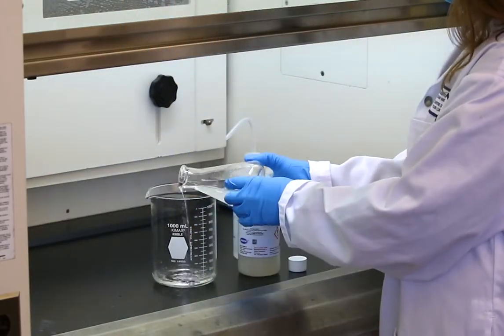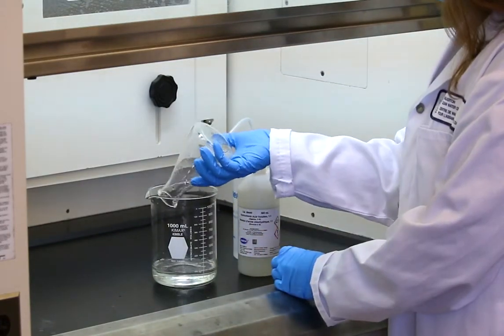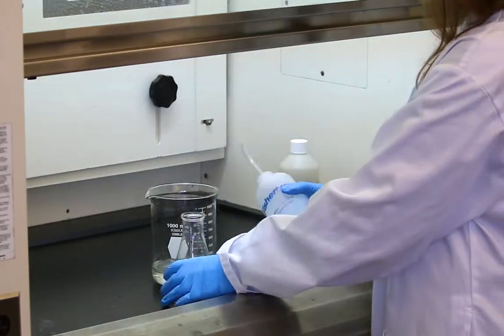Collect water samples in bottles that have been cleaned with six normal or one-to-one hydrochloric acid and rinsed with deionized water.